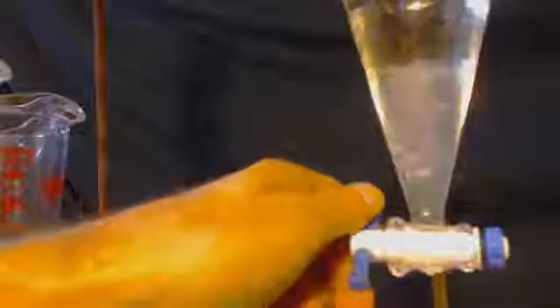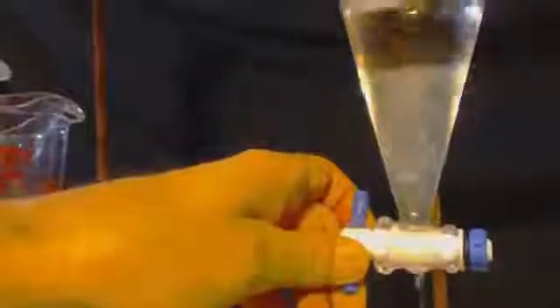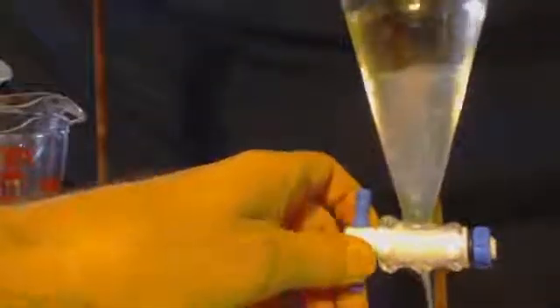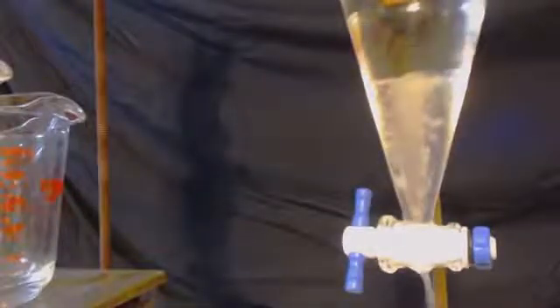As you can see, the bubbling there, that's probably the carbon dioxide coming out. They use that as a propellant, that's what shoots all the liquids out. Now, MSDS didn't say anything about solids, but you can see plainly here that there are solids in that bottom layer. I don't know what the deal is of that, but at least they're in the bottom layer where we're going to get rid of it, so it doesn't matter.